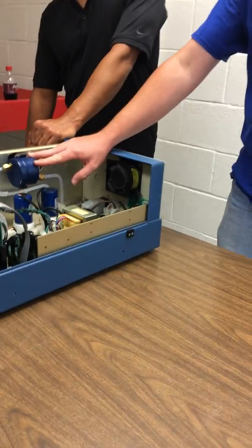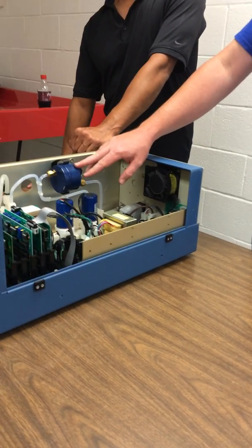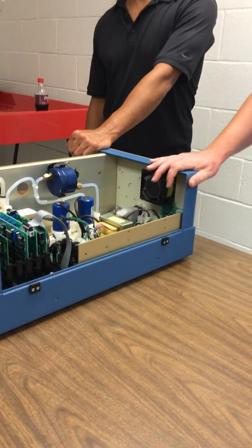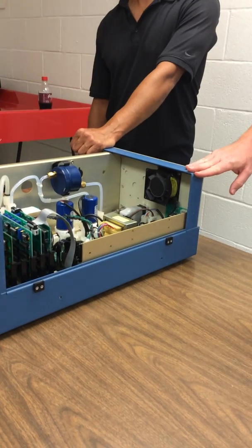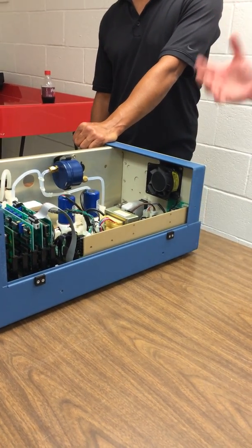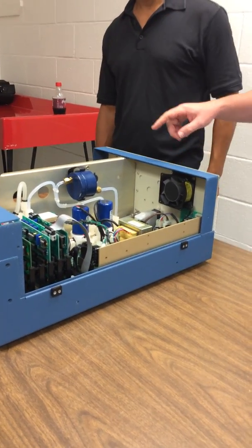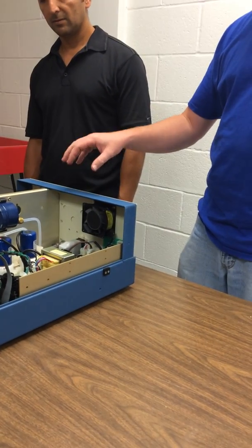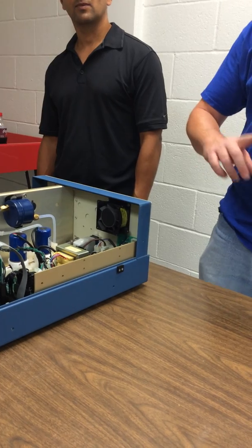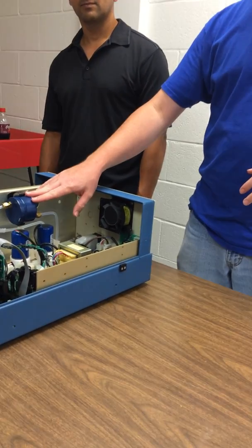We had one go out on us the other day, when we could see the pieces falling out. It's basically kind of like a steel wool. It's a lot of surface area. That's like activated charcoal. The reason activated charcoal works is that if you get it under a microscope, it's all surface area. We do use charcoal sometimes to scrub ozone when we're making zero air, but that also scrubs out SO2 and some of the hydrocarbons, which in this case we want to leave in.